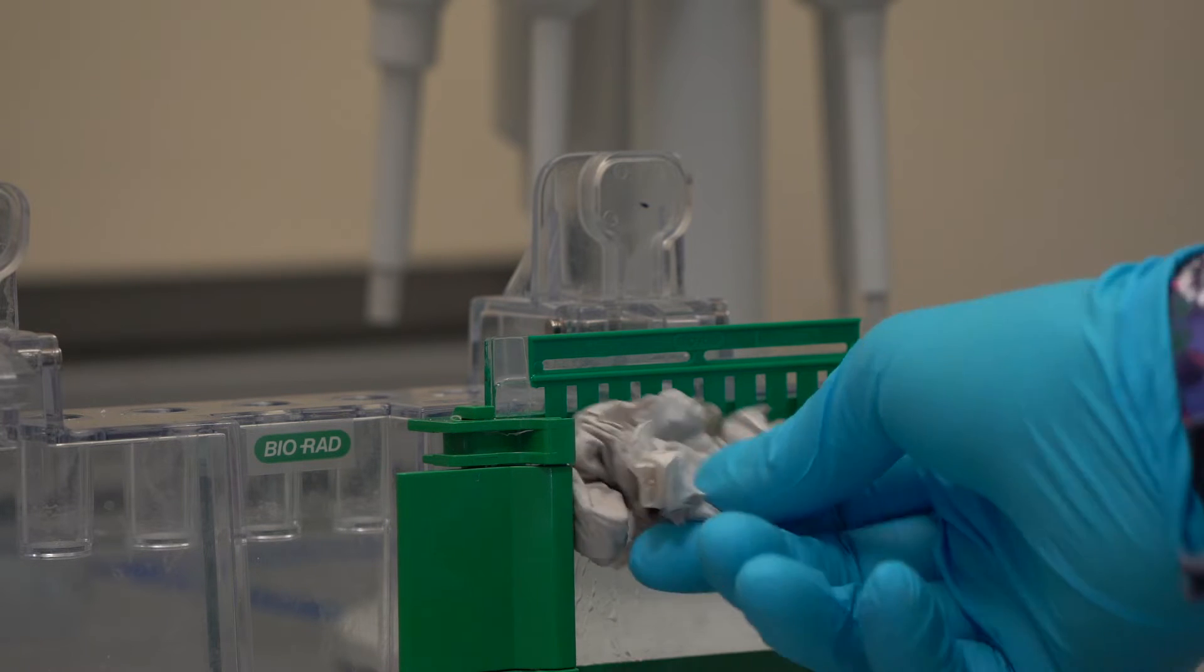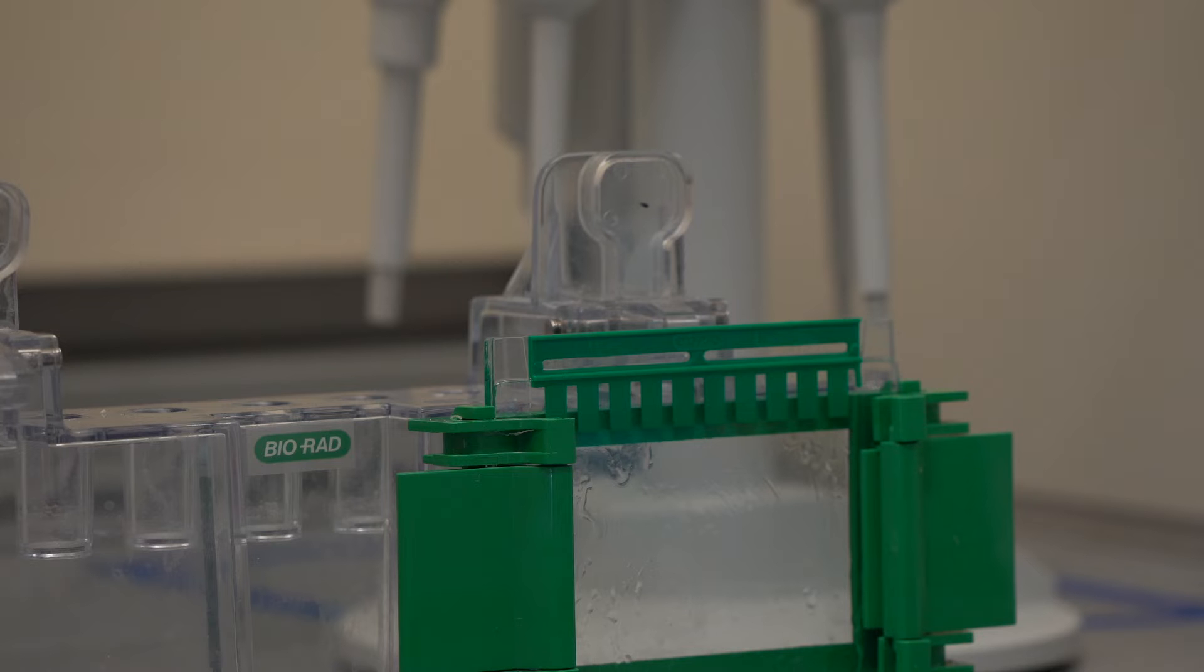Let the gel polymerize. When the gel is ready, it is possible to store the gel by putting it in electrophoresis buffer in the cold room.